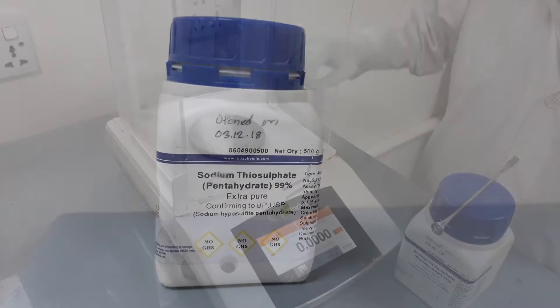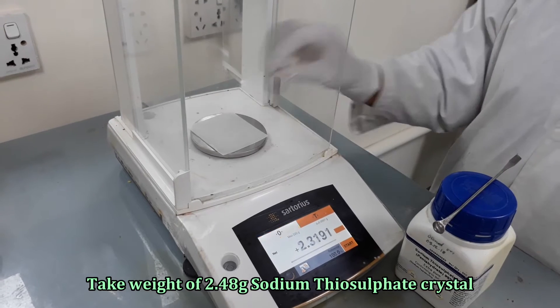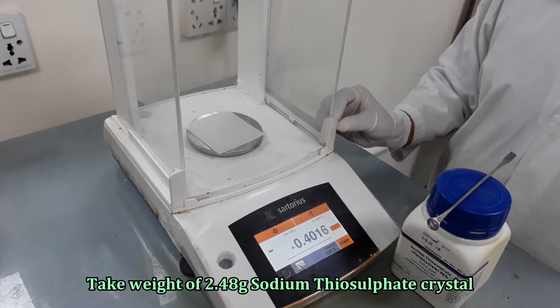To do this, take 2.48 gram sodium thiosulfate crystal into 100 ml volumetric flask.